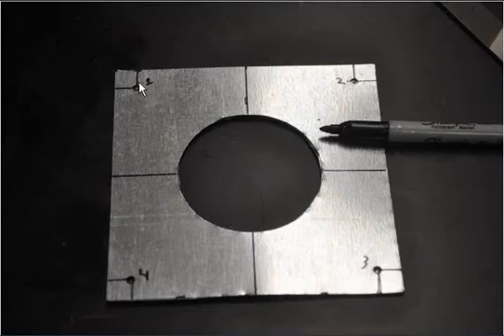And then we want to mark the orientation of the plates together. So I like to put 1, 2, 3, 4, or A, B, C, D, or however I'm going to know which side is which.